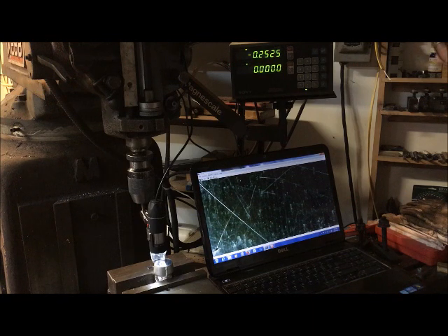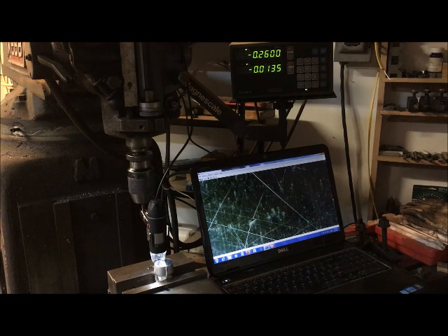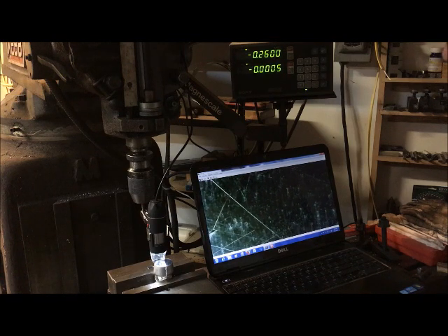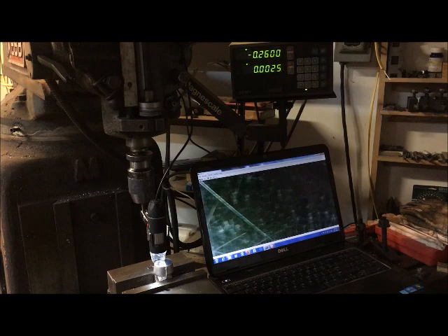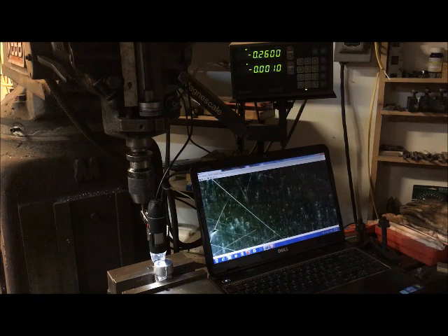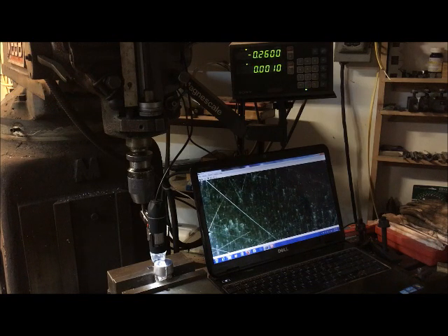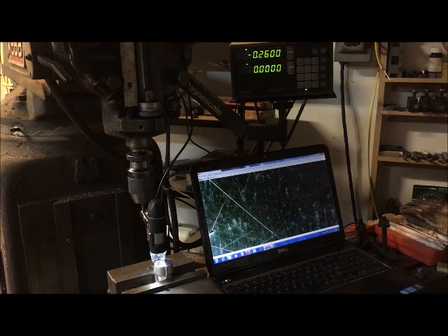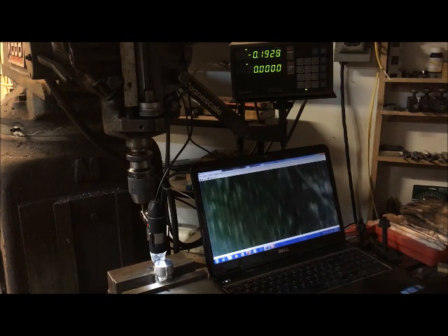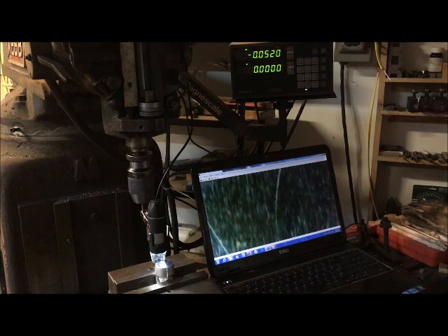Oh, there's a little defect right down in the corner. So how big's that thing? I'm not going to zero it, but the long width, there the point, well, it's right at zero. Okay, it's about 1.5 thousandths wide. I really want to go back to zero so I can find the other defect. A one and a half thousandth defect, if there's not a whole lot of them, isn't very big to me.